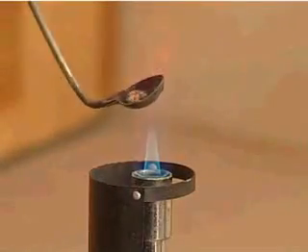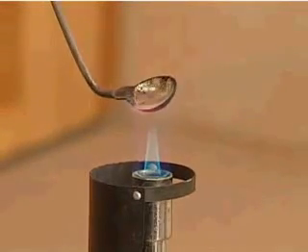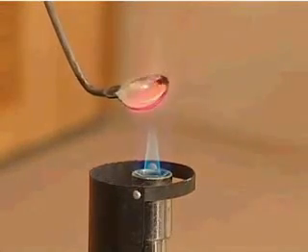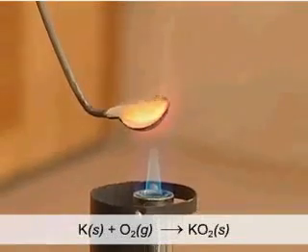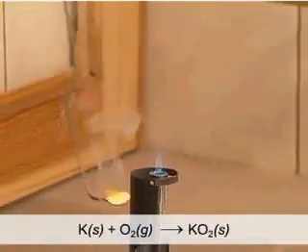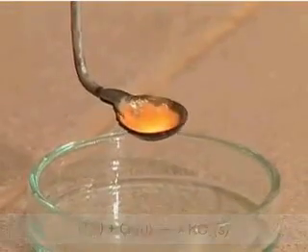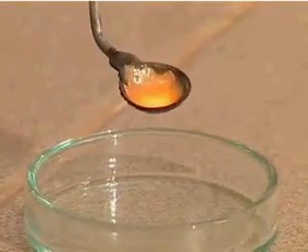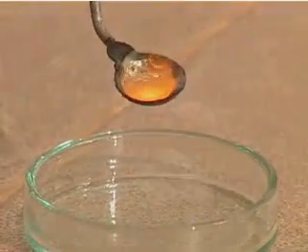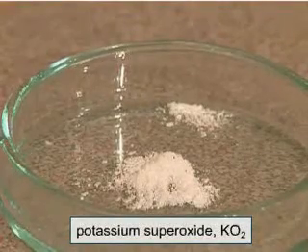At a high temperature, potassium initially melts and then undergoes a spontaneous exothermic reaction with oxygen from the air. When the product has cooled down, we collect it from the spoon. The compound obtained is potassium superoxide, a white crystalline solid.